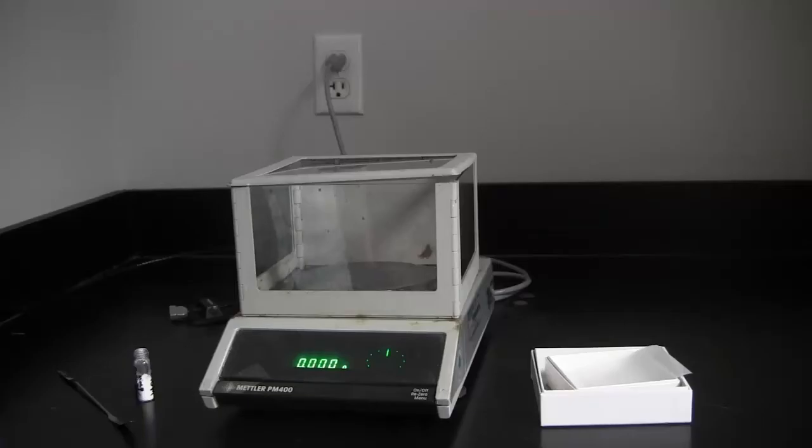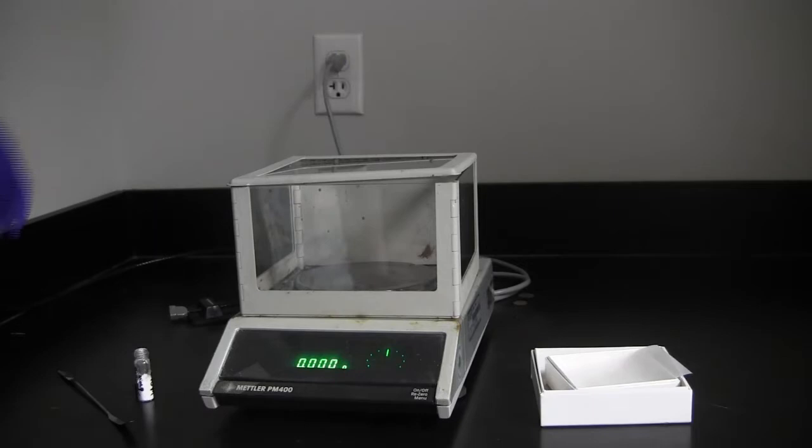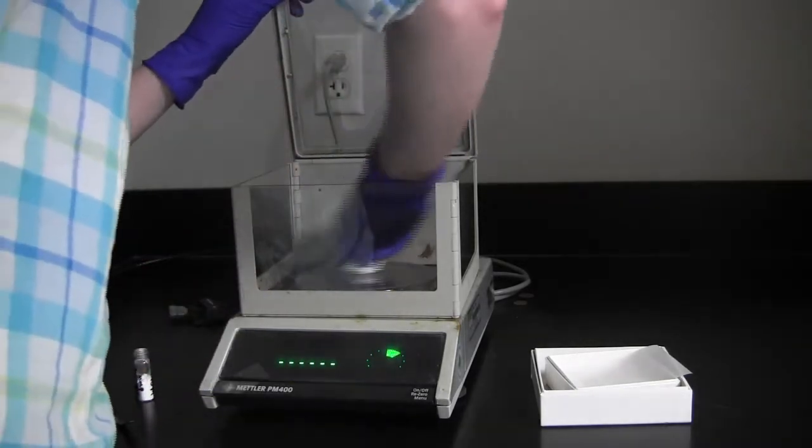To start, make sure that the scale is on. If it is not, check that it is plugged in and then press the bar on the front of it to turn it on. Also, make sure that the scale is clean. Do not trust the person before you to clean it up.